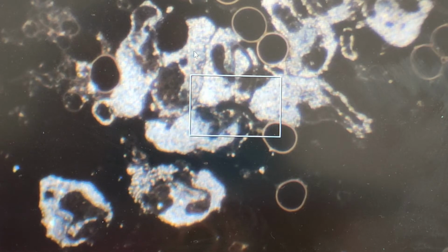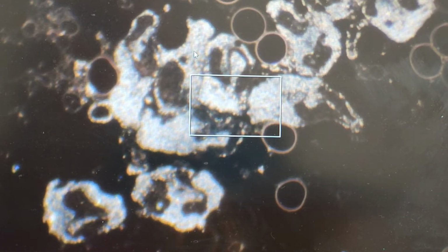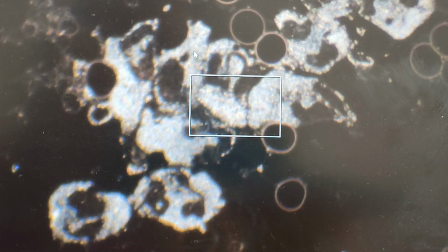A symplast simply means a sort of aggregating together of elements. And in this case, the elements are all neutrophils. And as I speak to you, you can actually see them moving. And so this is a really good illustration of how white blood cells communicate with each other. They've all been called to be in this one area, and they will have crawled through the blood sample to meet and come together here.